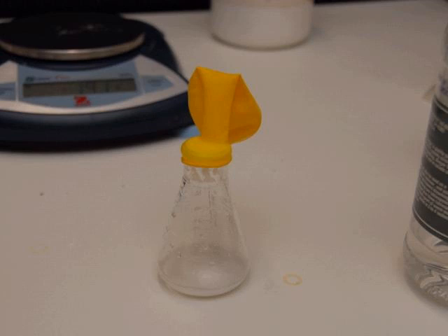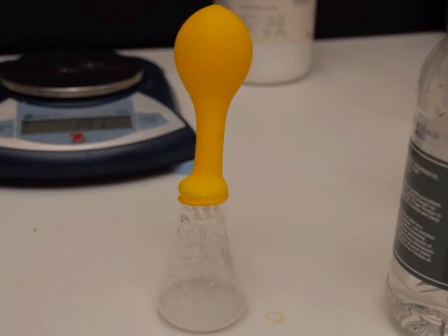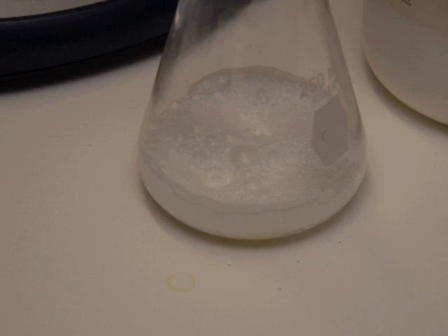So get that balloon on as quick as you can, and it will start filling up with gas. And this is a smaller Erlenmeyer flask in this picture. It's better to use the large one because you are able to collect more gas. So mix the vinegar and baking soda, put the balloon on, and then you can pick it up and swirl it around, and it should keep reacting some, especially if that baking soda was in a big clump. If you swirl it around, it'll mix in with that vinegar better and create more gas.